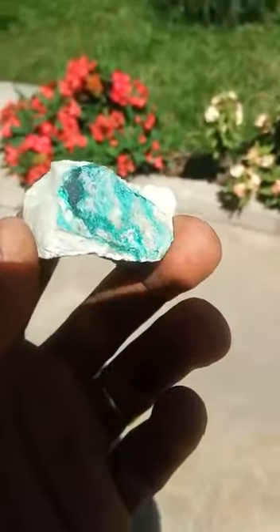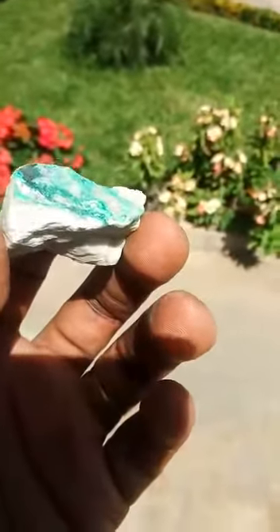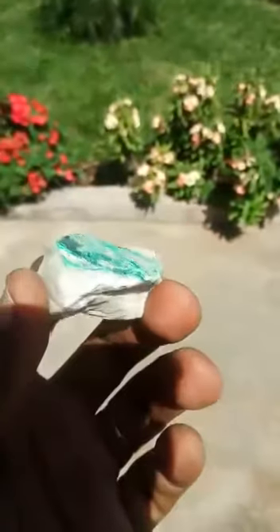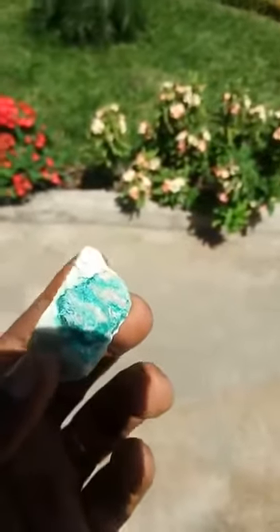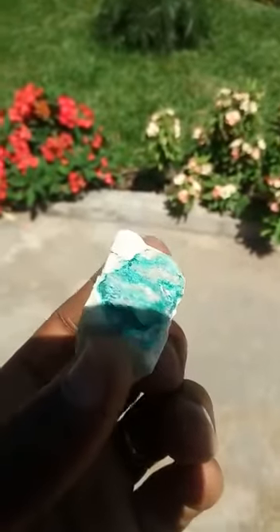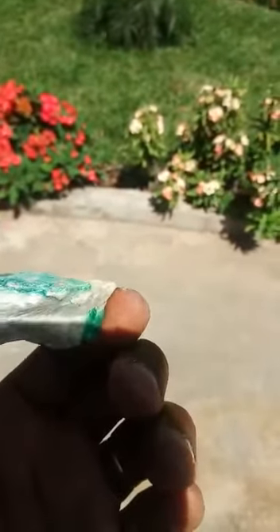So after the leaching process, I'm going to remain with some sludge, which is basically solid particles which did not dissolve at the bottom of the reactor, and that is basically the impurity. So that is the first stage, where I'll separate the copper from its host rock, and basically separating it from the impurities, and then I concentrate it into a solution which is copper sulfate.